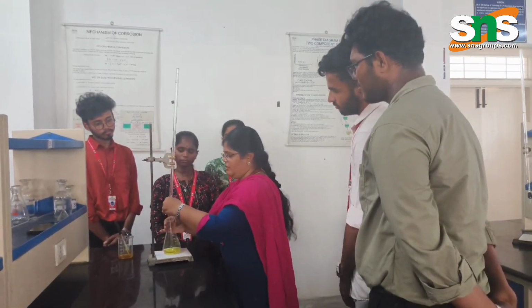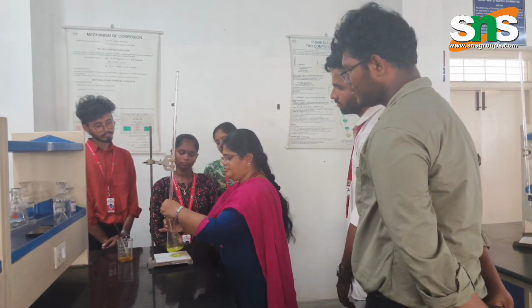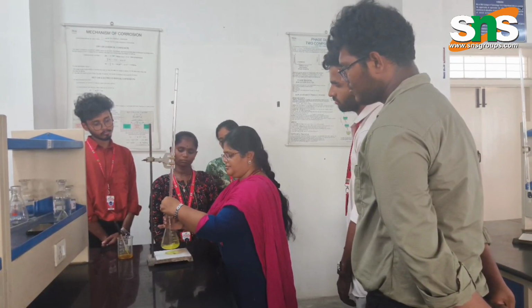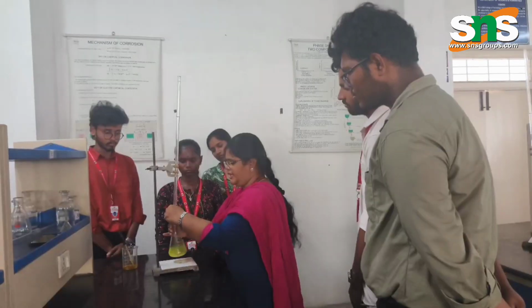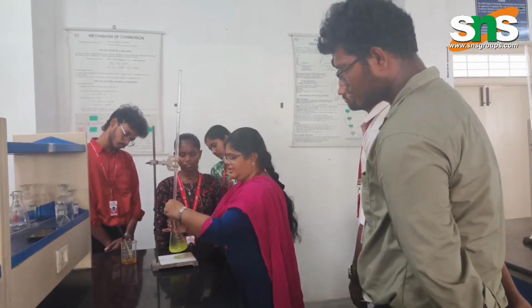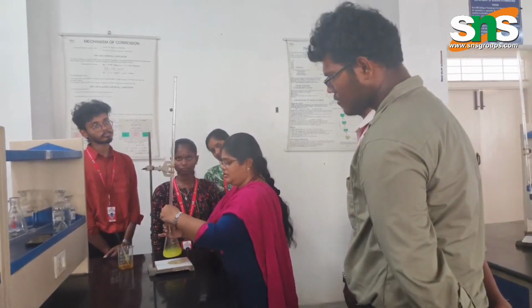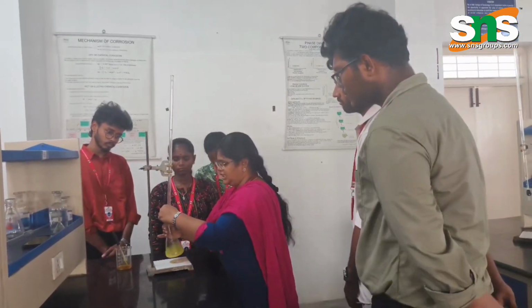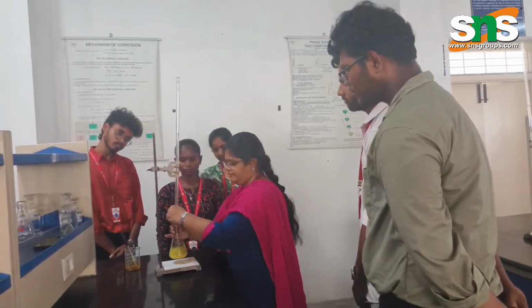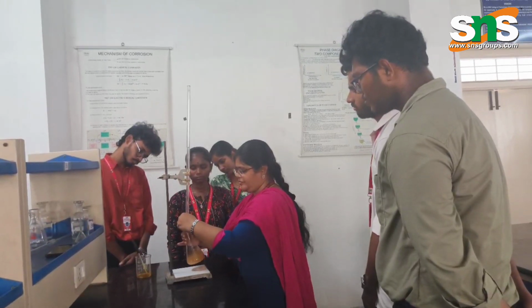Now I am titrating. You have to get the whole solution into the reddish tint.